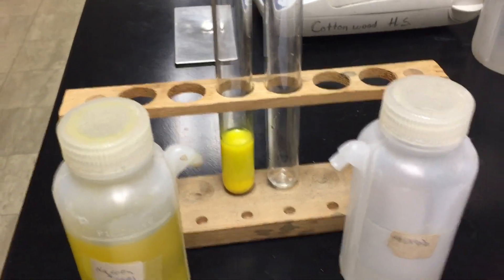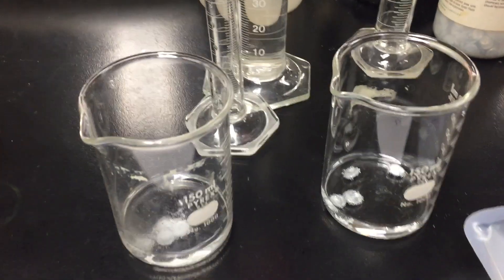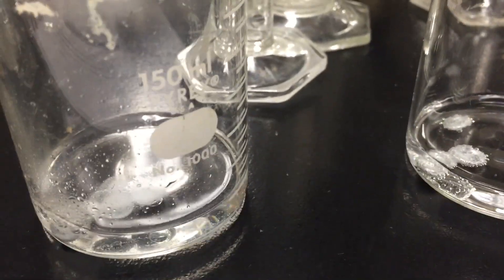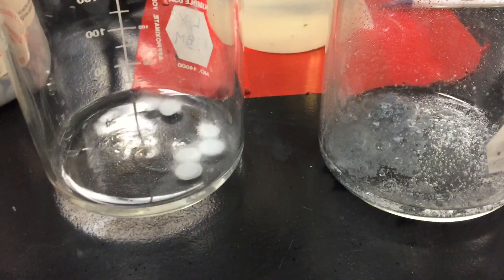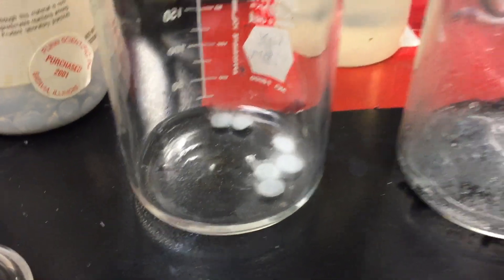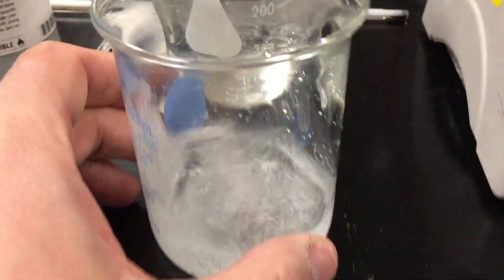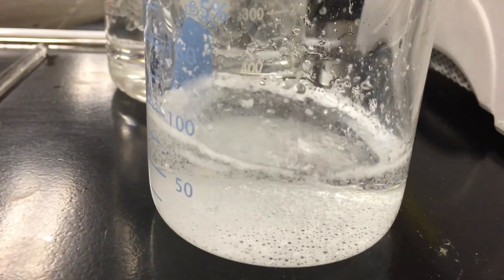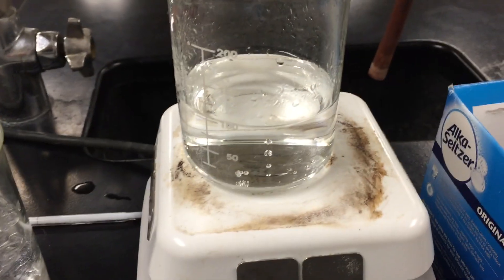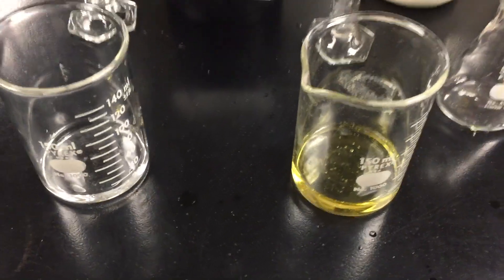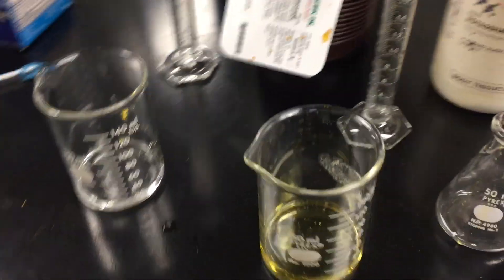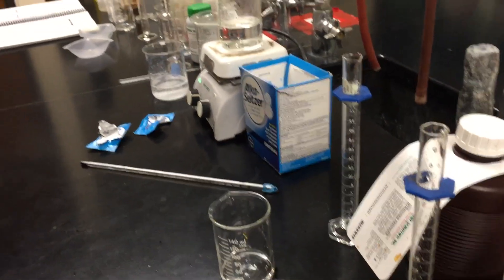So we've talked about several things. We've talked about the nature of reactants. We've talked about concentration, remember 6 molar hydrochloric acid and 0.6 molar hydrochloric acid. You can see the relative rates there. We've talked about surface area, and so we have zinc powder and the zinc ingots. And then temperature. Looks like this Alka-Seltzer tablet might finally be dissolved. This one has long been dissolved. We then talked about the use of a catalyst and lowering the activation energy of a reaction. So I hope you enjoyed those demonstrations. Talk to you soon.